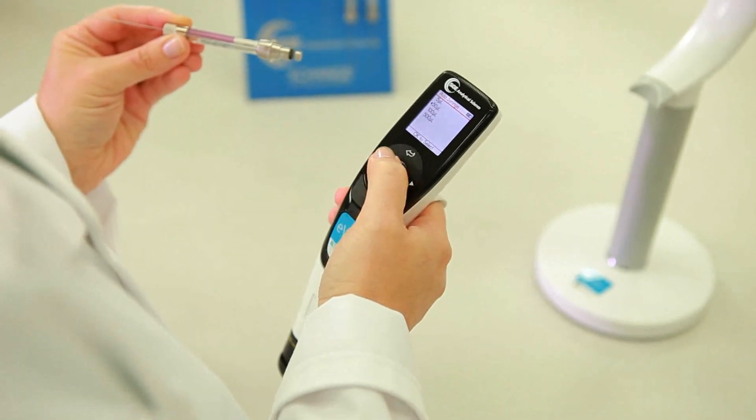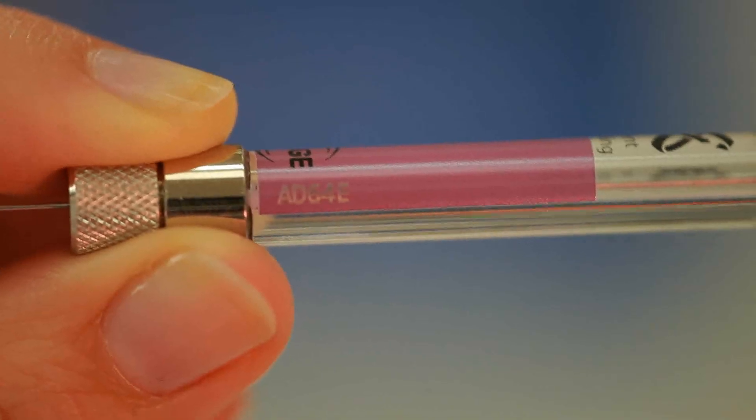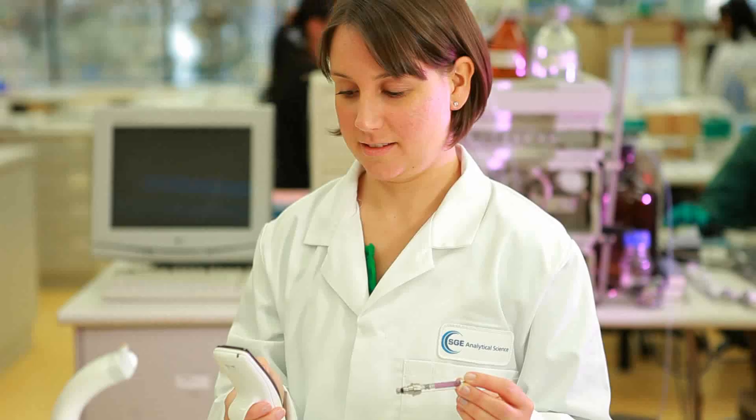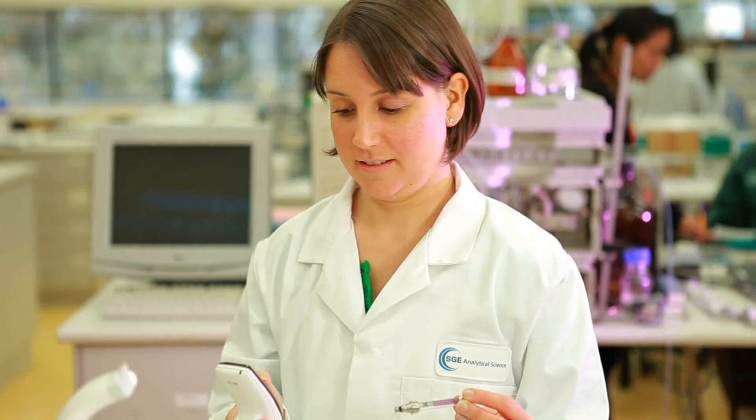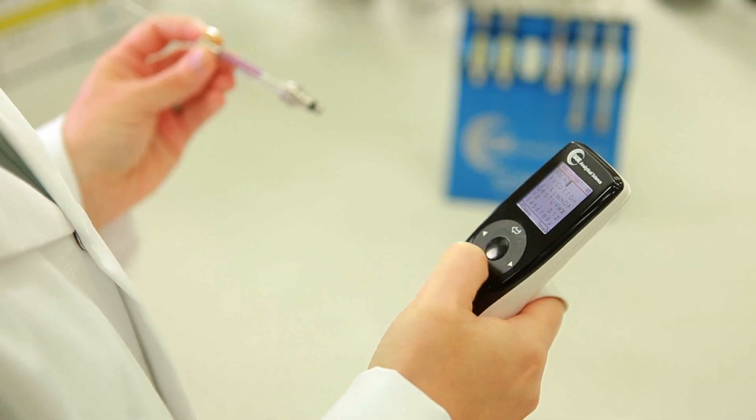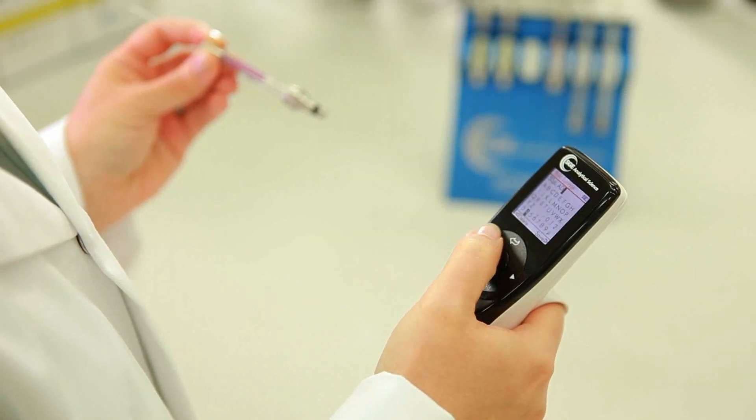For more traceability for the user, a unique ID can be set for each syringe to allow users to allocate different syringes with similar capacity for different solvents. Using the displayed alphanumeric input screen and the touch wheel, enter your desired ID. You can use the unique ID inscribed on each syringe, or you can name syringes as you wish.